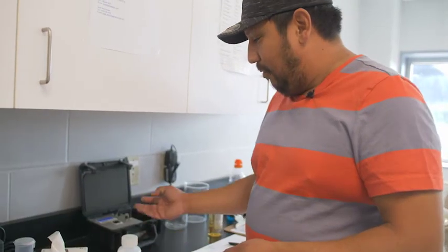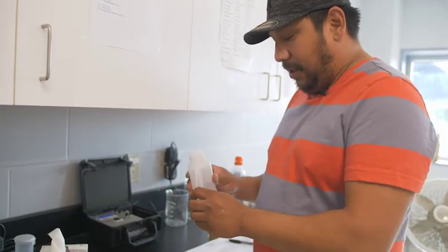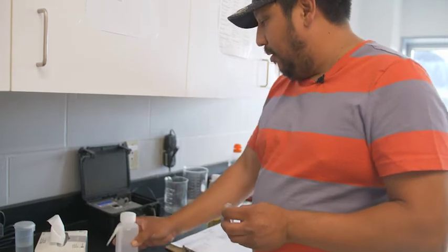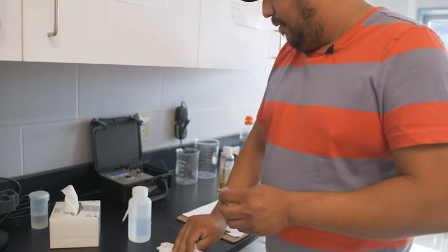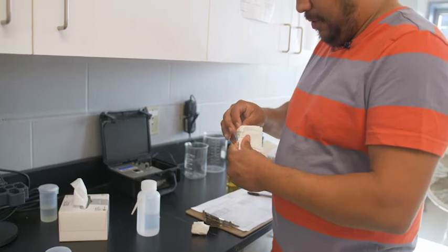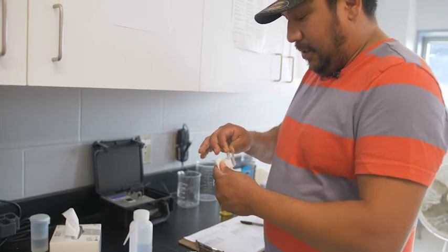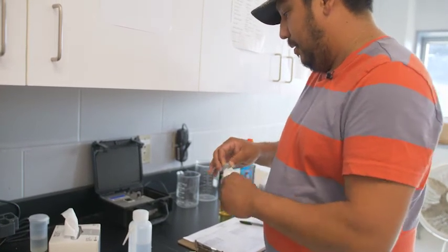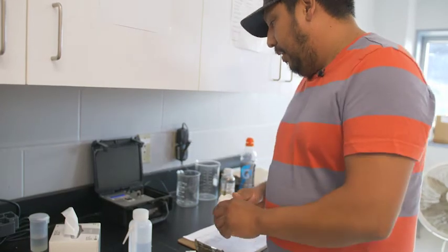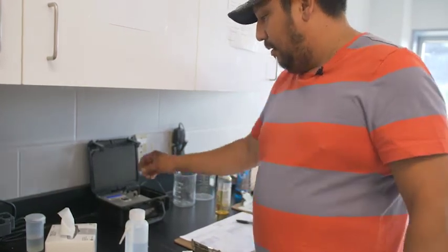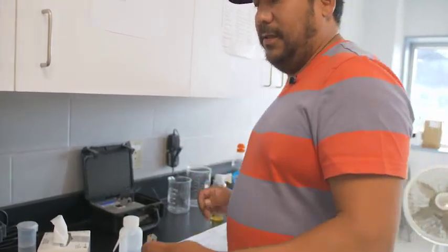When we first start the unit we're going to calibrate it using distilled water which is free of any blockages, any organisms that might be in there. And you should get a hundred percent with distilled water, so there's it's free and clear.